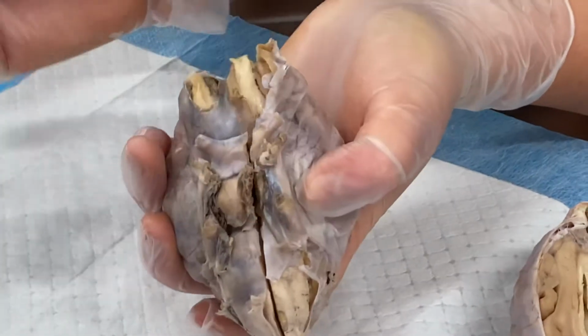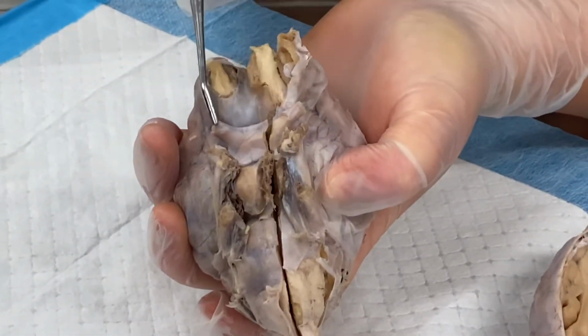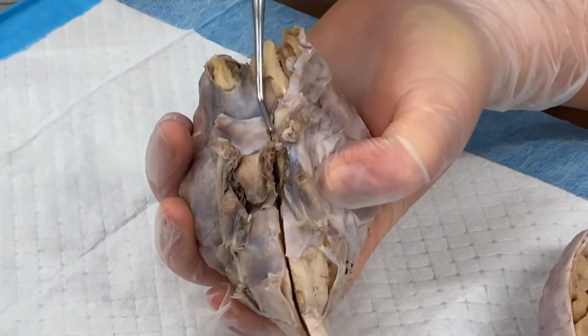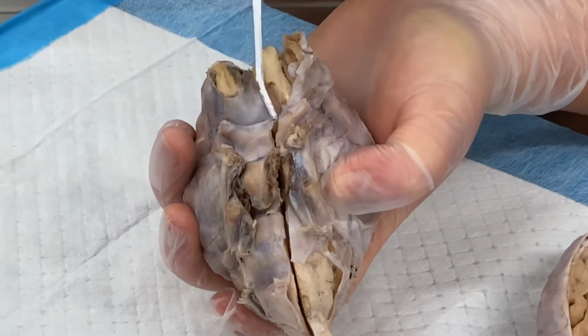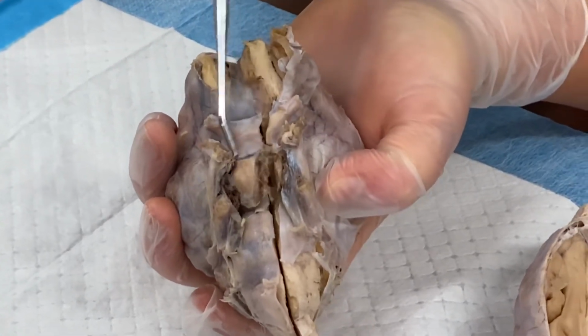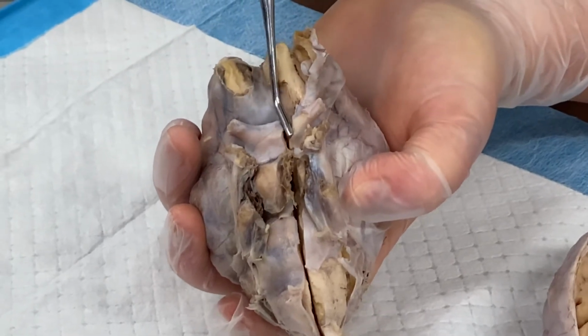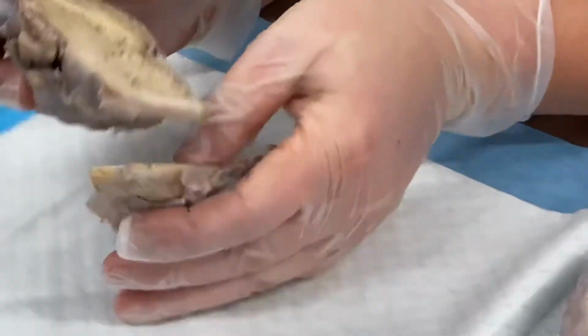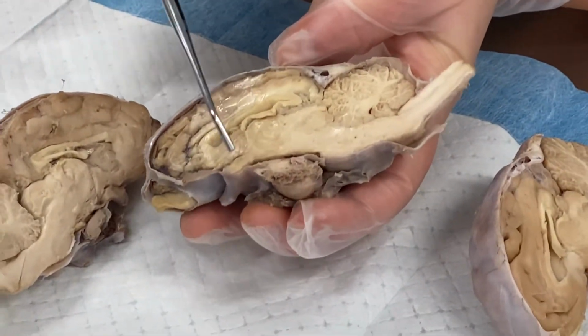Then we have our optic. So we have our optic nerves that jut out on the side here, these top horns. Right in the center where they meet, that's our optic chiasm. And then where you can't see, these make another little X on the bottom, that's your optic tract, but you can't see that. So we have our optic nerve, these horns, and then our optic chiasm. And the optic chiasm you can also see inside. So it's this hard bony thing right here.